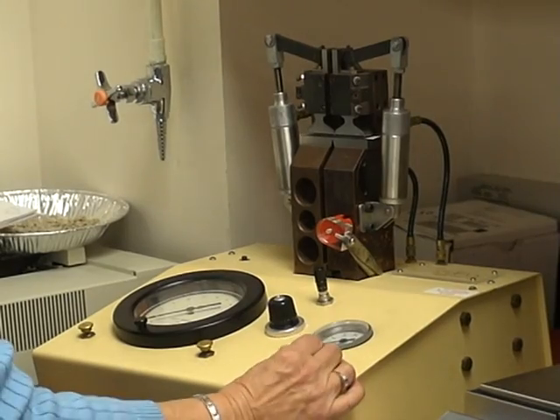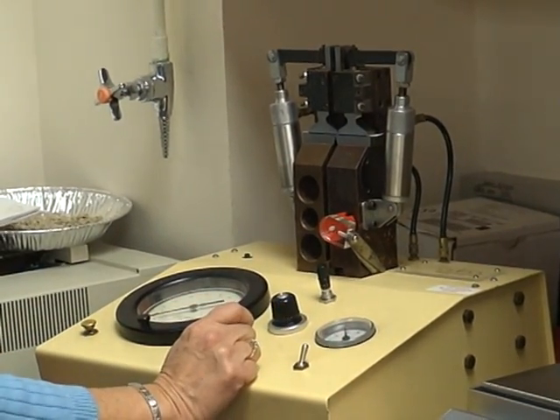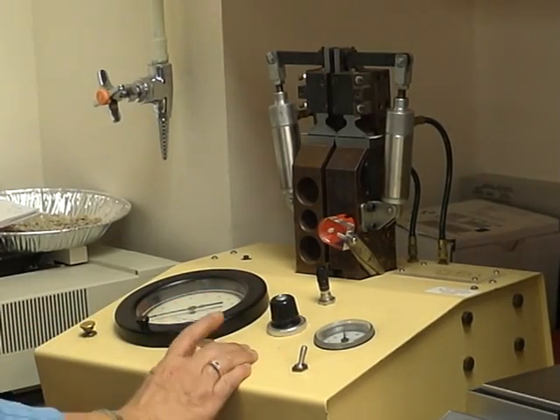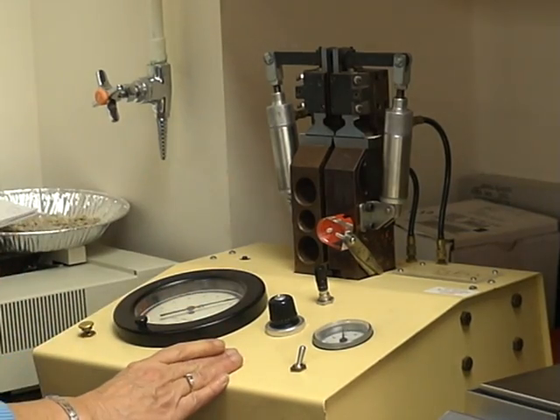So slide our sample in, hit the switch, wait for it to go to 60 psi. Once you're there, push down number 4 so we can do the test until it breaks.